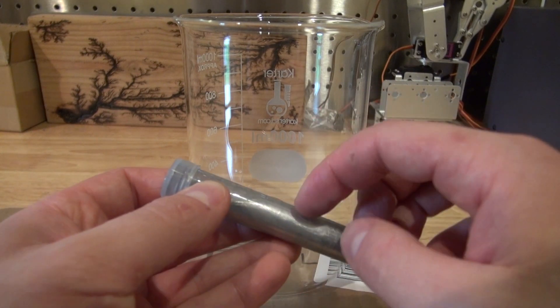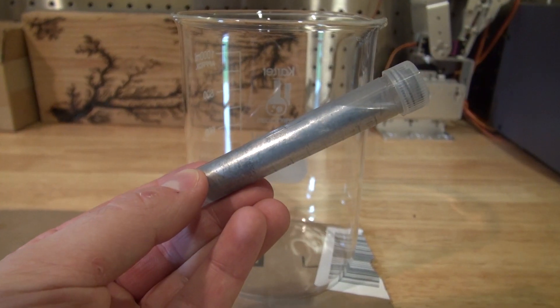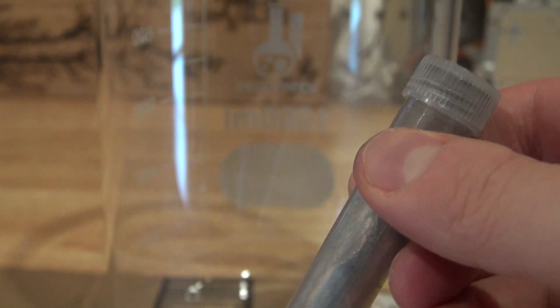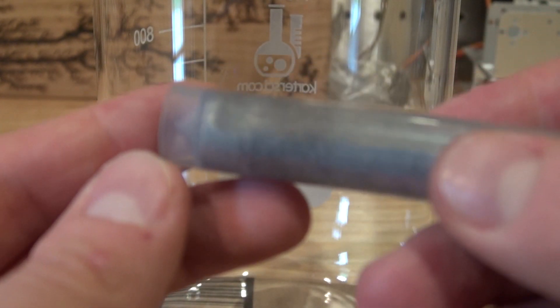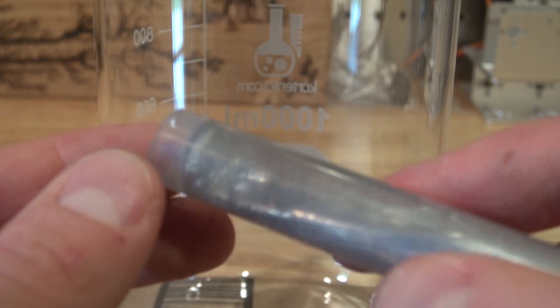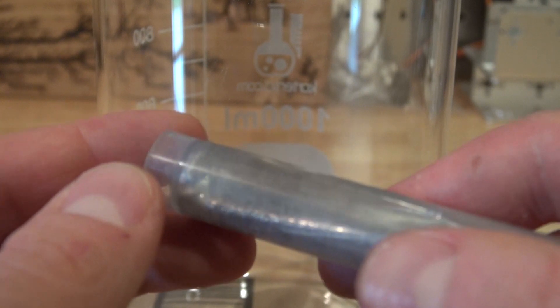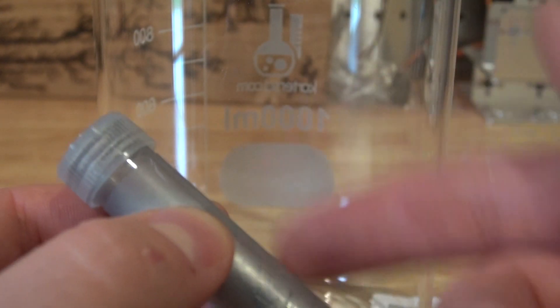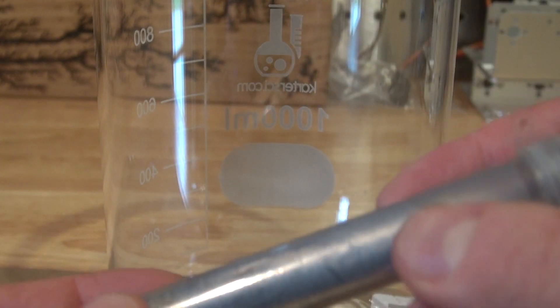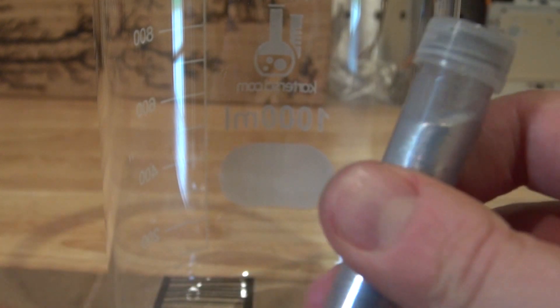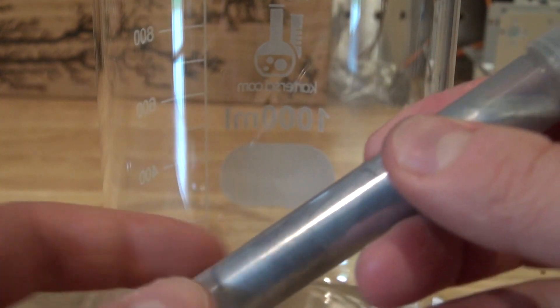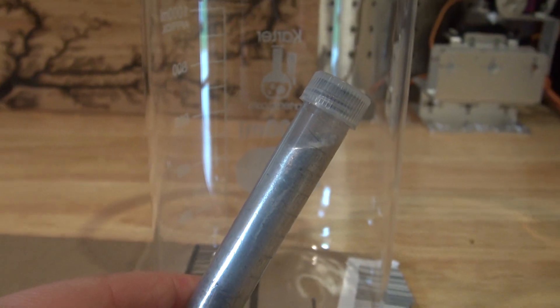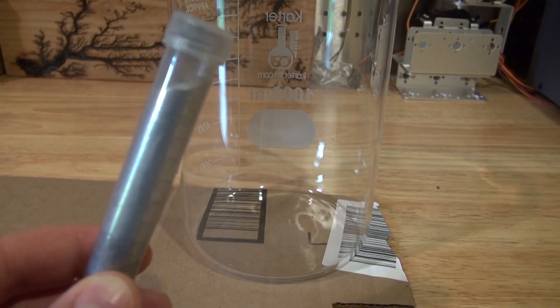What I'm going to do is pour this liquid into the beaker. I've noticed that even though I've had this in hot water for about two hours, coming back every 10 minutes to reheat the water, if I look carefully right here, there's a chunk of indium. So it's not fully dissolved. This means my ratio wasn't fully accurate. I'm going to need to add more gallium. I have this little chunk of gallium I'm going to rub in there to make more liquid like I did previously. Let's see how this liquid looks when I pour it in.